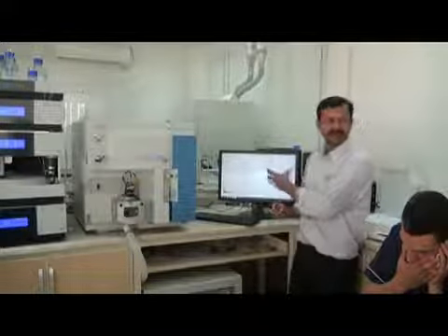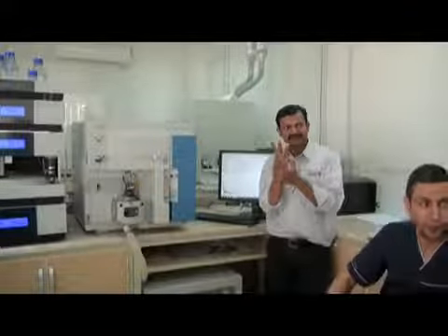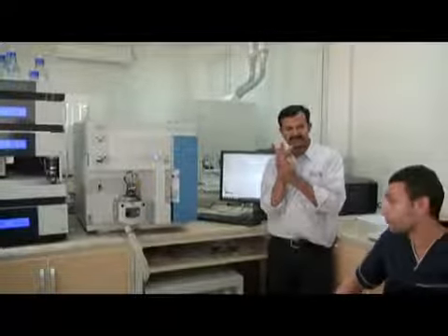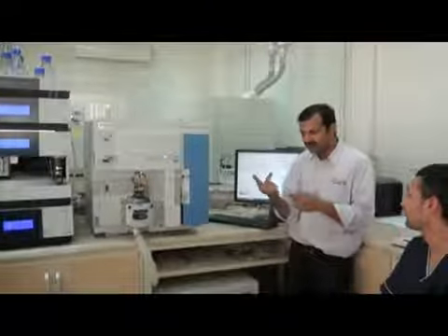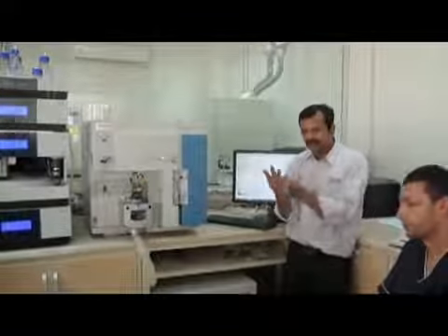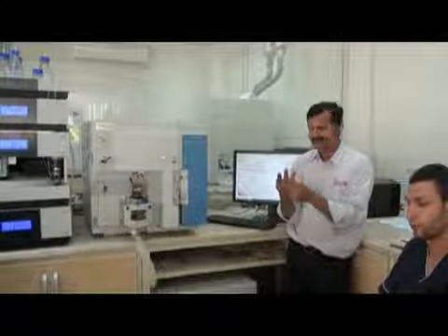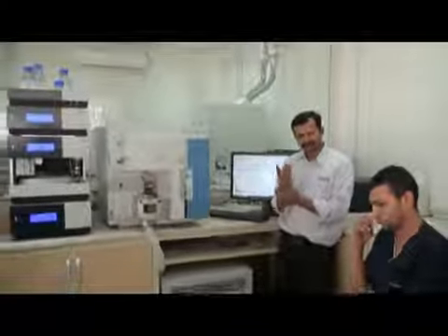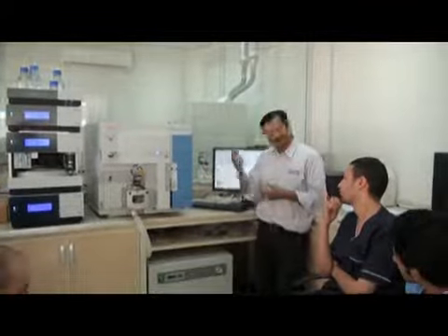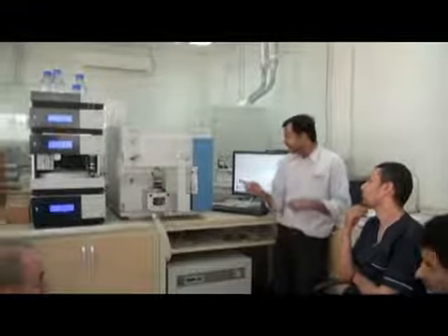There are 3 powers in total. One for the vacuum, second for the electronics and third for the main power. Vacuum, electronics, main. Vacuum is always on, never off. Always on.